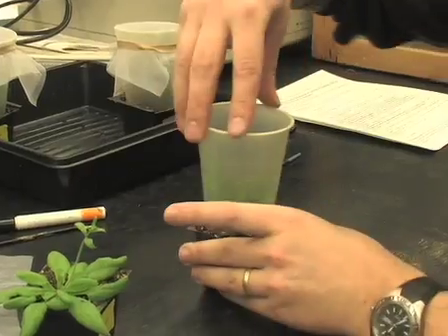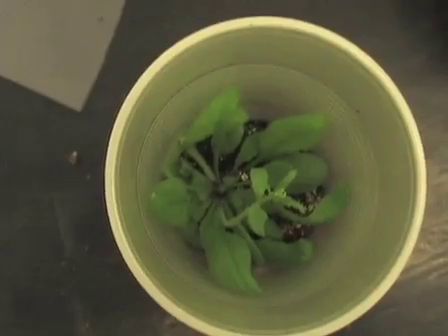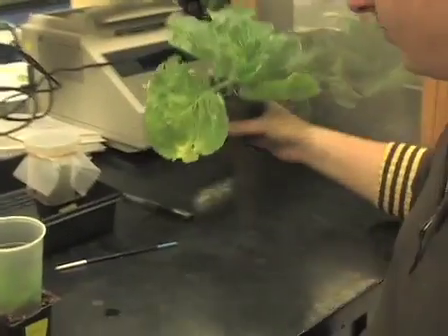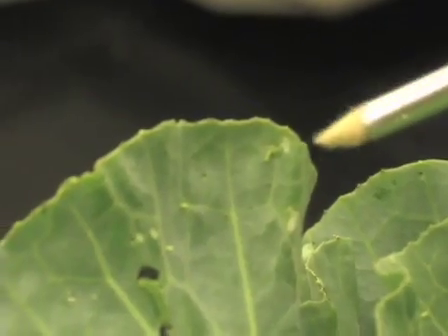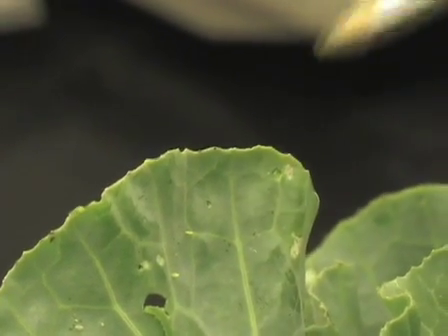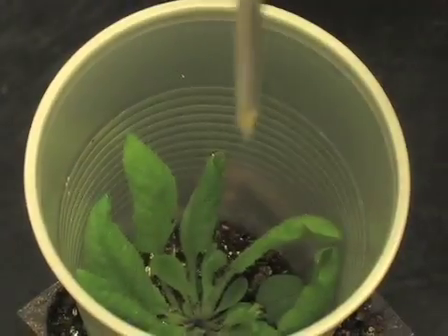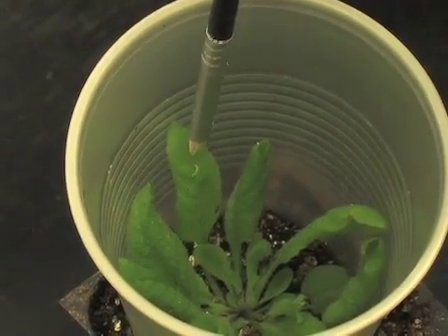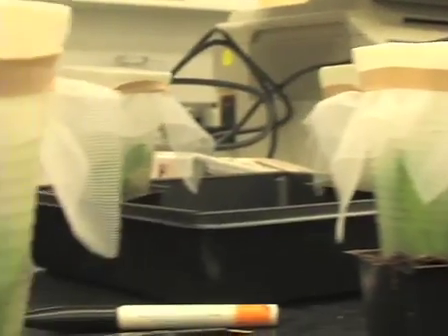We have a no-choice experiment here between Arabidopsis wild type and the mutant plant. The mutant is a jasmonic acid-impaired mutant and probably more susceptible to feeding. This is a no-choice experiment because one larva can only choose from one genotype of plants. We're going to add one larva to each cup. It's important to start off with larvae that have just hatched — these are called L1 larvae. I'm going to carefully place this larva on the test plant, then enclose these plants using a fine mesh and an elastic band so they won't crawl out.